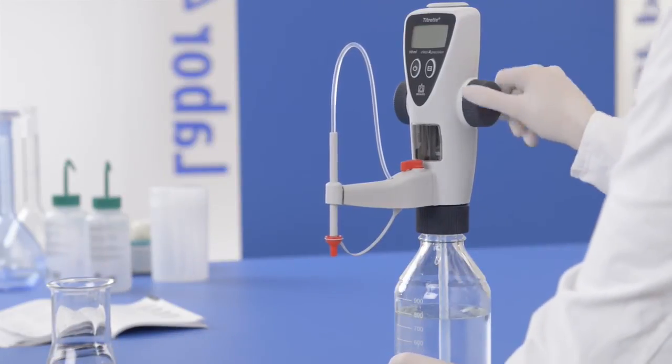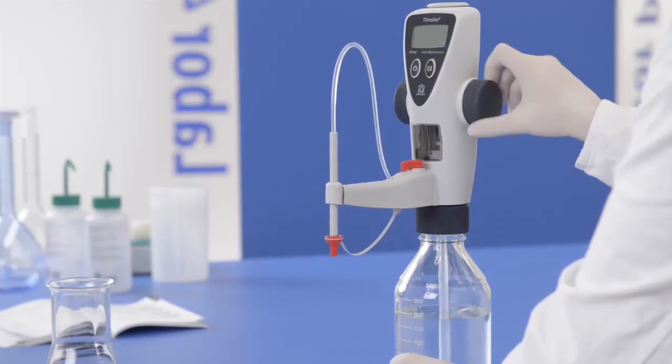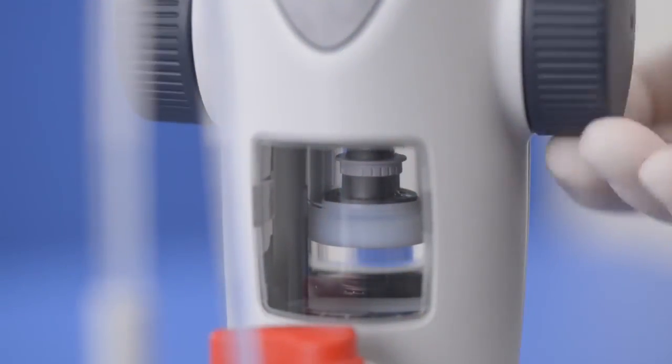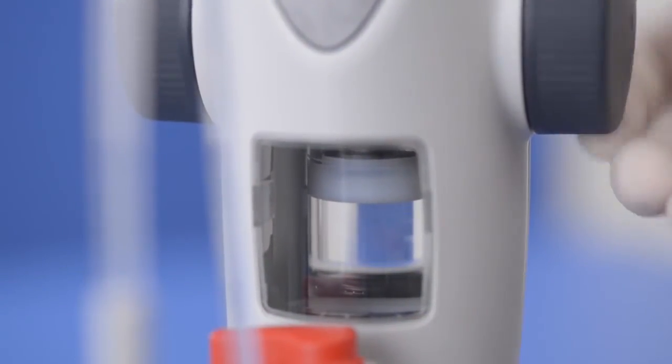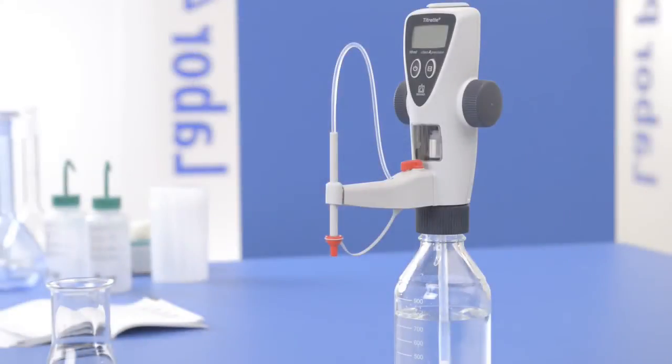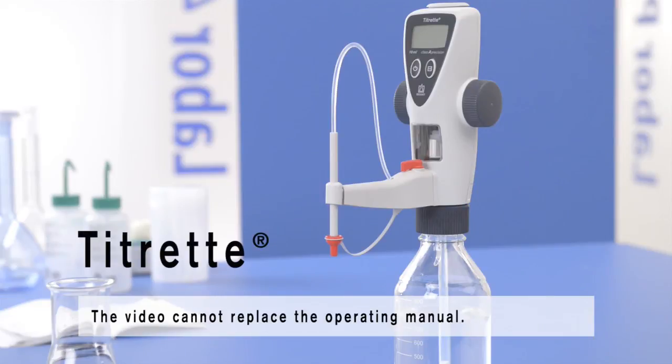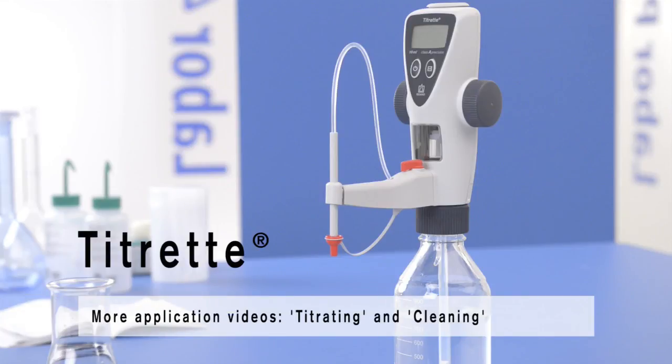Raise the piston to the stop. You are now ready to use your Titrette.